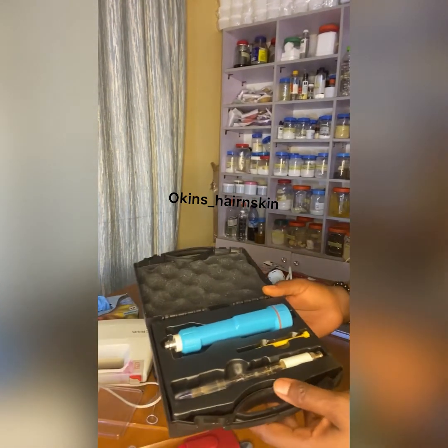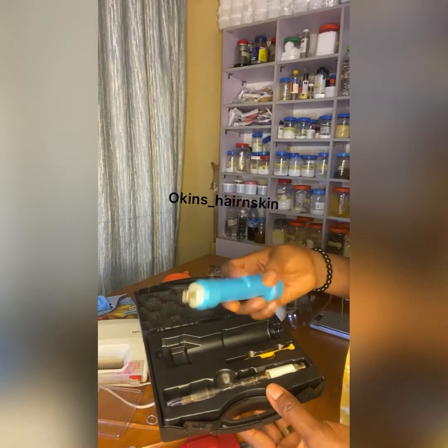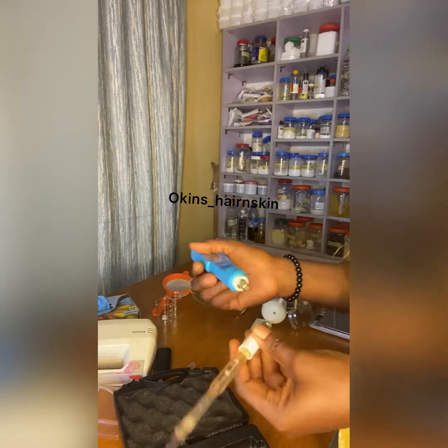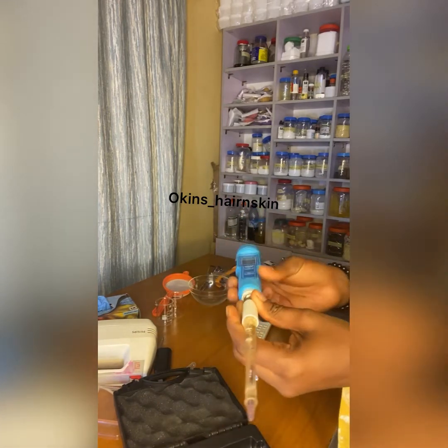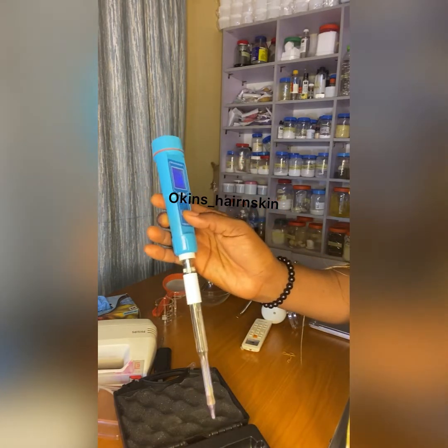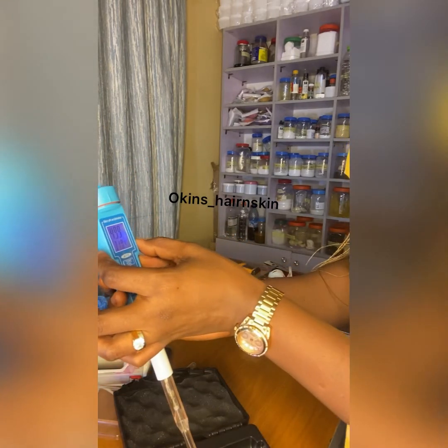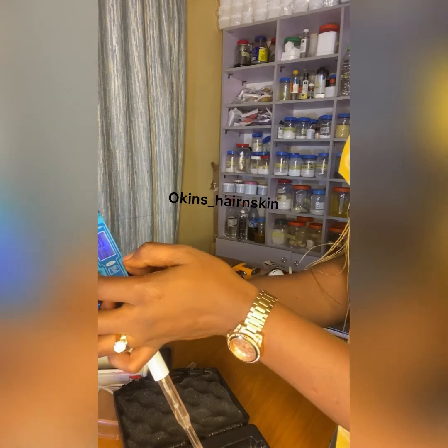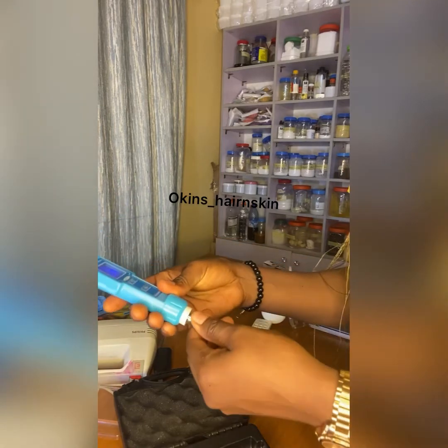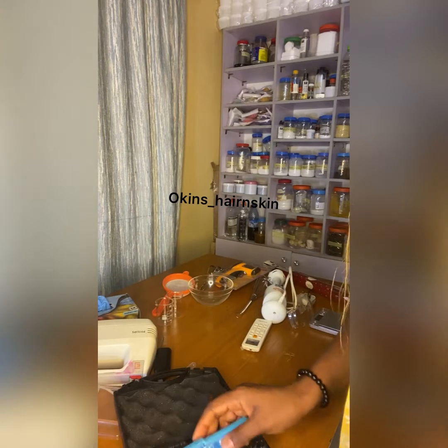So starting with the pH meter. This is the pH meter. You fix this, then you turn it on. You insert it in your product, then immediately it will read. This pH meter reads the pH and the temperature, which is very good. So when you finish, you rinse with distilled water carefully and keep it.